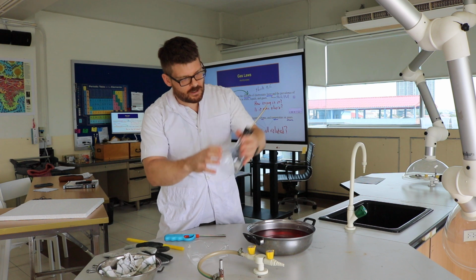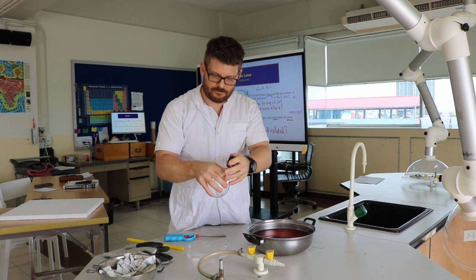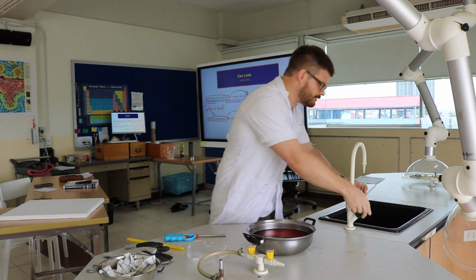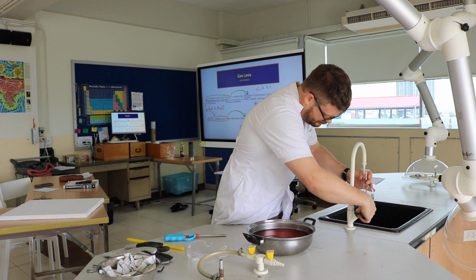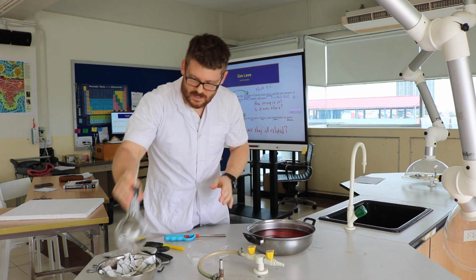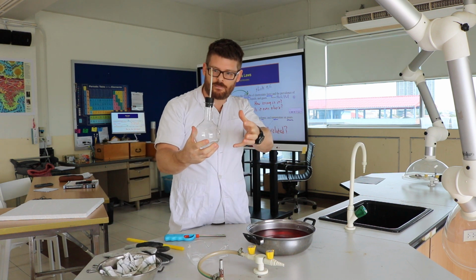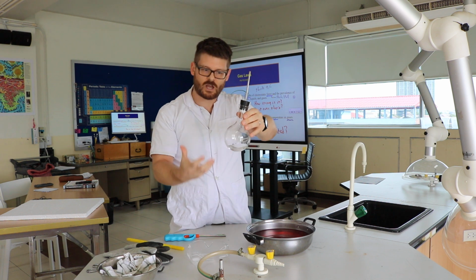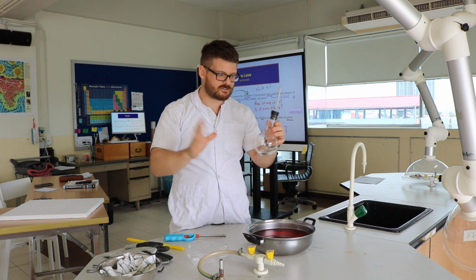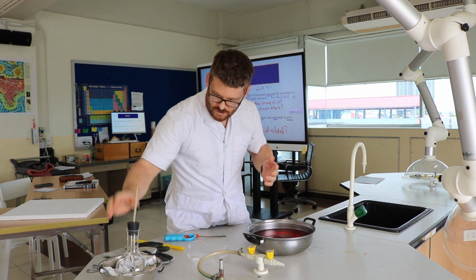I've got a flask here, and this flask has a rubber stopper on it with a hose that's coming out. I'm going to put a little bit of water in here, just a little bit, okay? Alright, doesn't take much. Set that aside for now. And what I'm going to do with this is I'm going to heat this up, and it's going to cause the water inside here to boil, and then I'll leave the suspense. There's going to be something I do at the end that's going to have a dramatic finish to it.